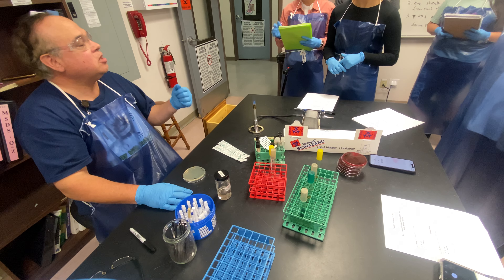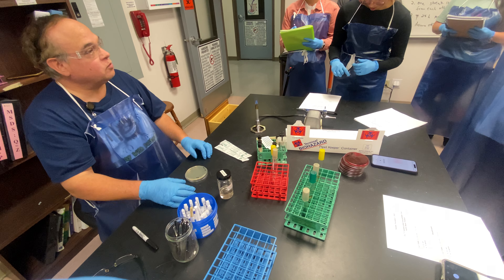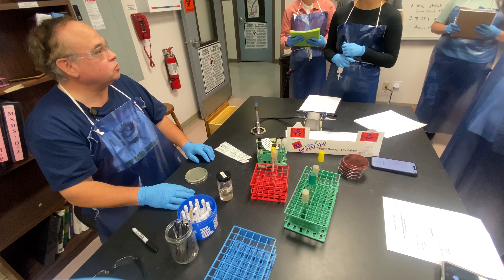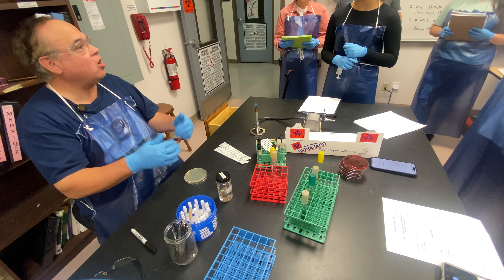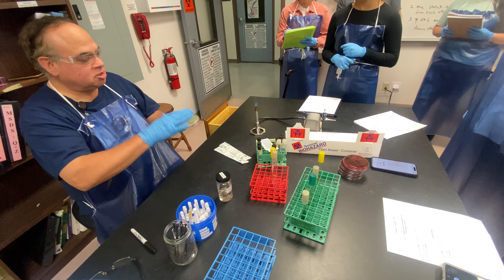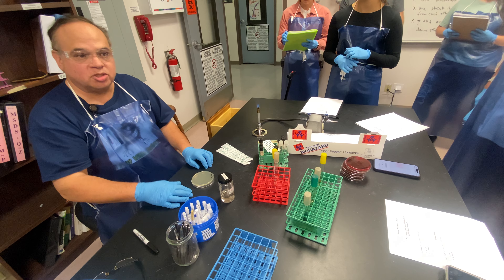Kirby-Bauer — the two scientists who actually came up with the process. It's very easy to do and it's a lot of fun. Here at Riverside we don't have a lot of the beautiful amenities that some of the other campuses have, so we have to do it old school. The first thing we want to do is prepare what we call confluent growth, sometimes known as a lawn of growth. What that means is we want to put a population of organisms on the surface of the plate so that we can challenge the antimicrobial agents.